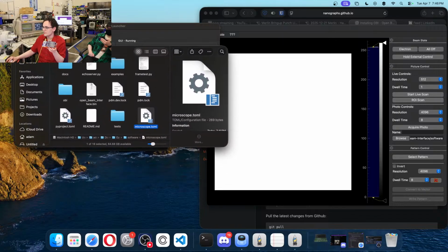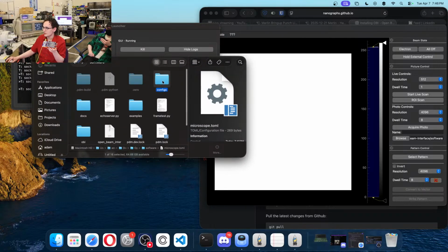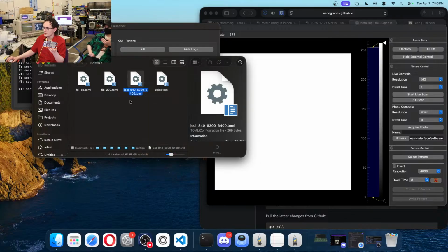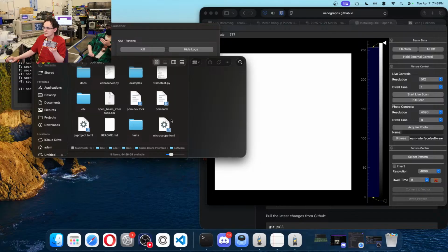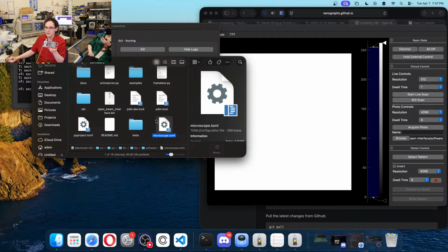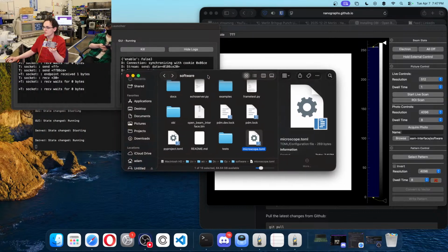So what I had to do is go into our configs here. We have a couple of example configs. I right-clicked, copied our JEOL config, and brought that back up to the top level. I pasted it at our top level, and then I renamed it to be microscope.toml, because that's what actually gets looked for when the software runs.